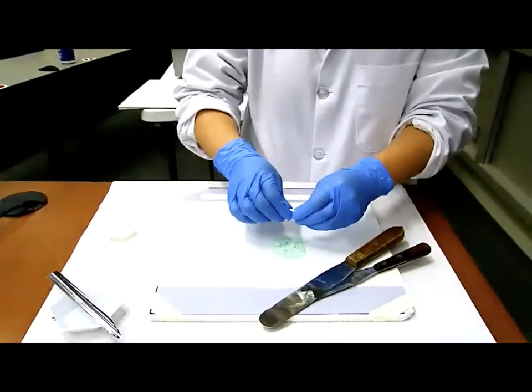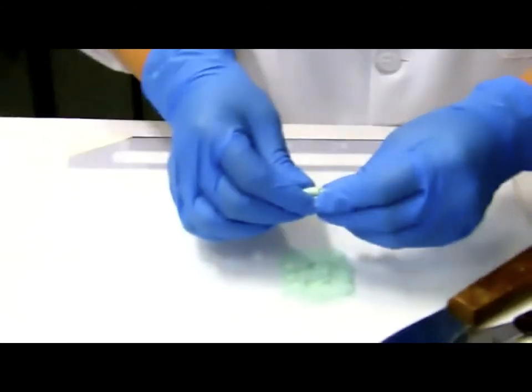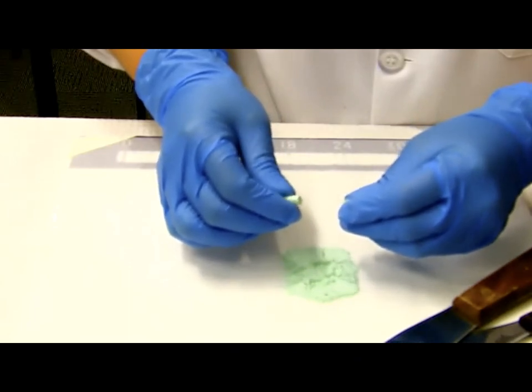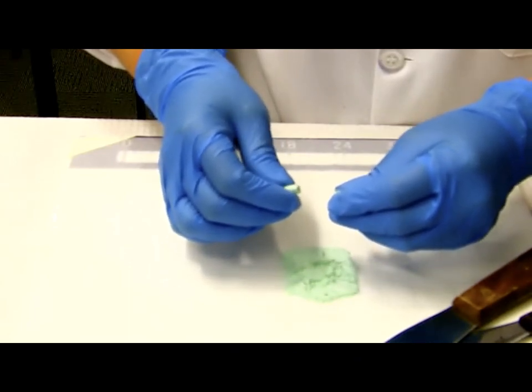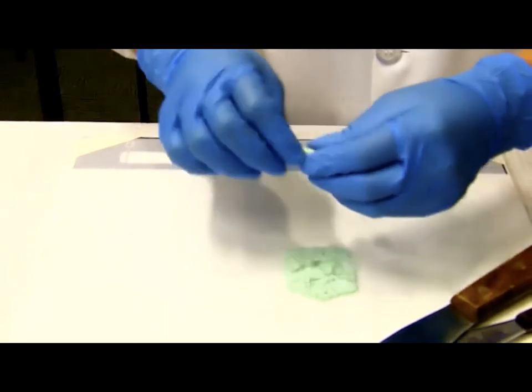All right, so then I need to get rid of some. One second, hold it. Let me zoom in. Okay, so I'm going to get rid of some excess. By squeezing it, the powder will come out. So it's a really good adjustment that you have to do.